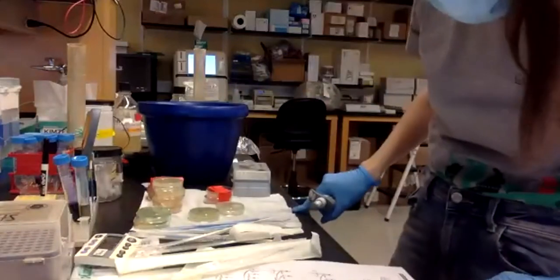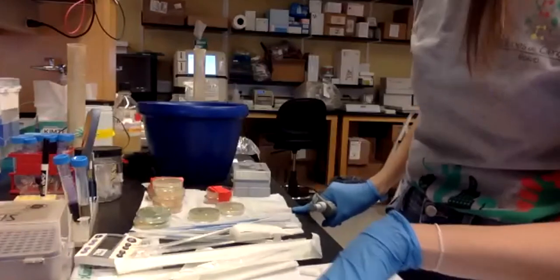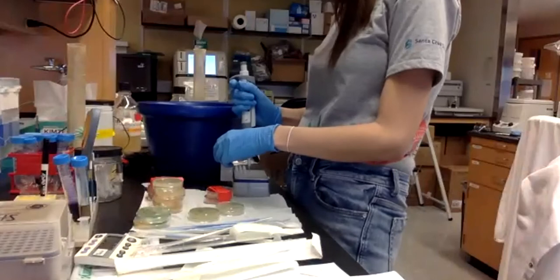Put it on ice, and then it says I should put the donor guide plasmid into tube B and D. So write that down.